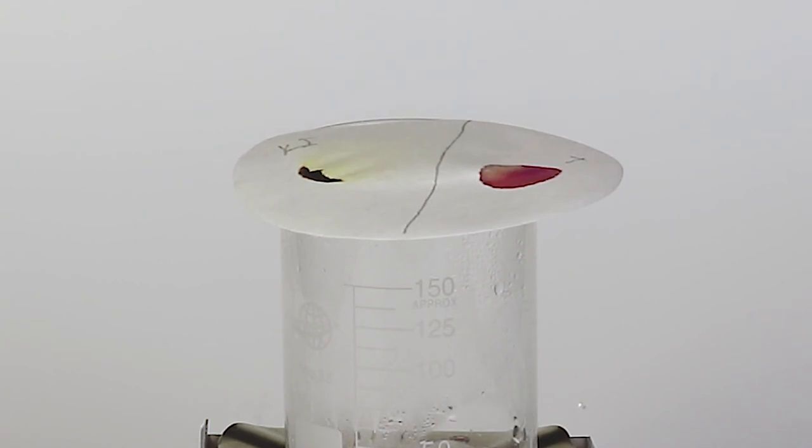As a result, the chlorine reacts with the iodine and the iodine stain slowly loses its color.